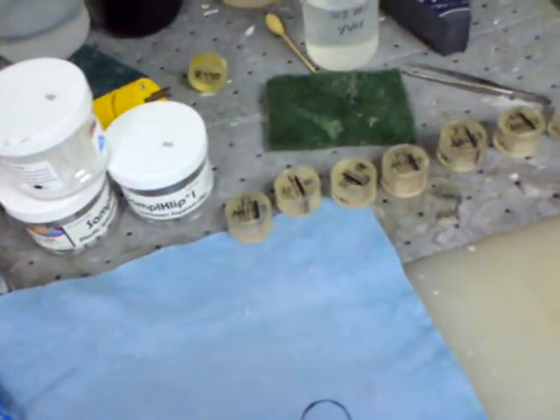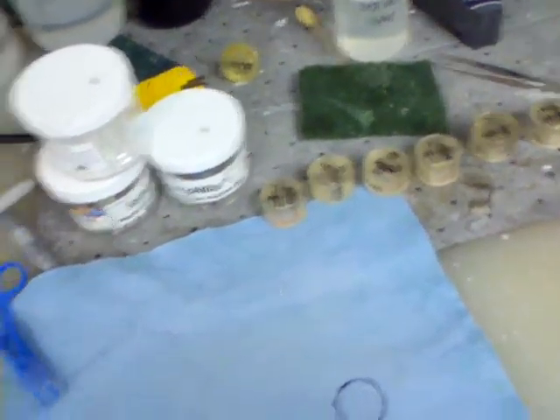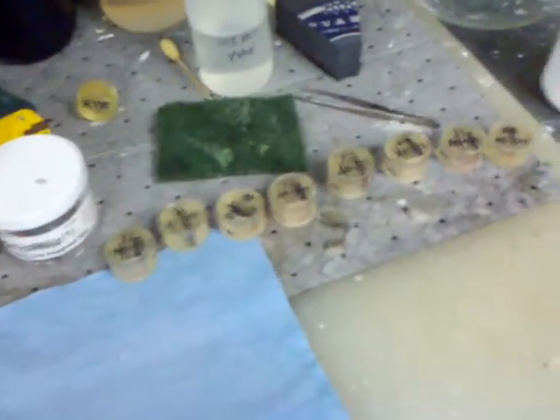Each board has 12 samples. So it's five, five, two — that's how we're handling it. Three samples per each board, and ten boards altogether per material type, which is 30 instead of... well, it was 120 per material before. So yeah, a lot of work here.